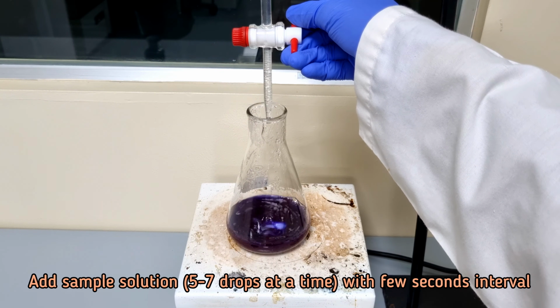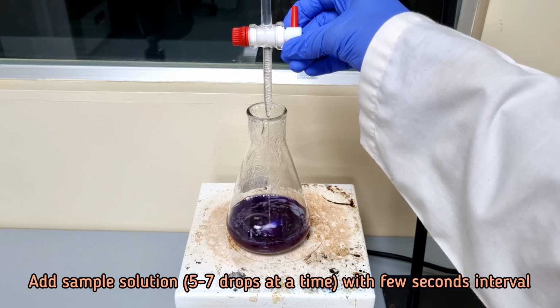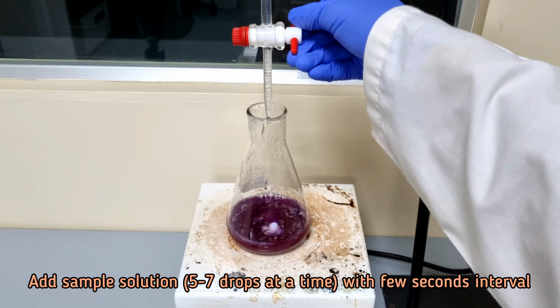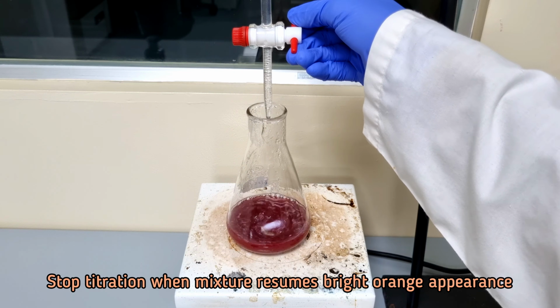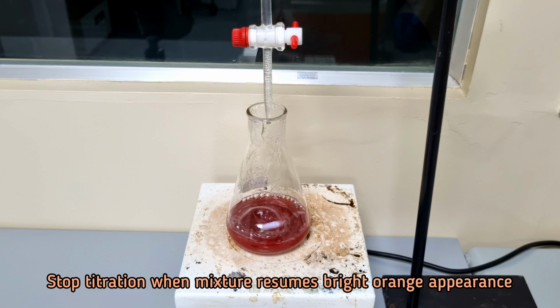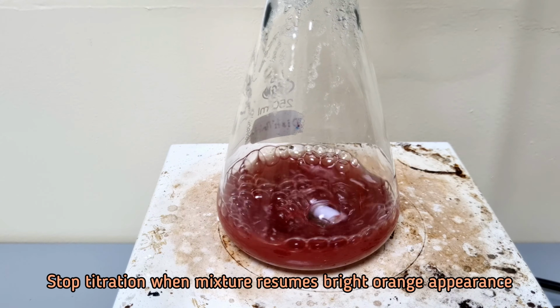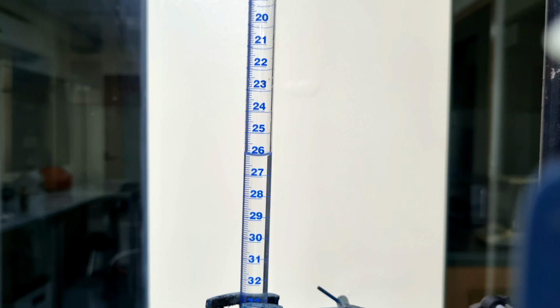In this way, complete the titration within 3 minutes. Stop titration when the bright orange appearance is observed. Note the final burette reading of the sample titration.